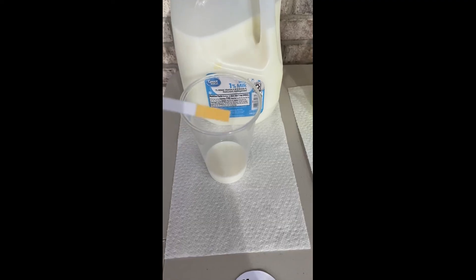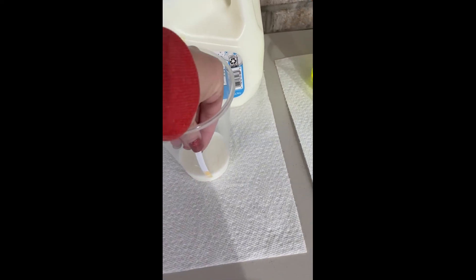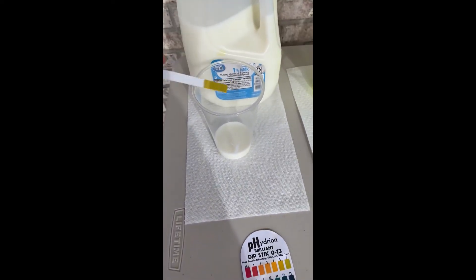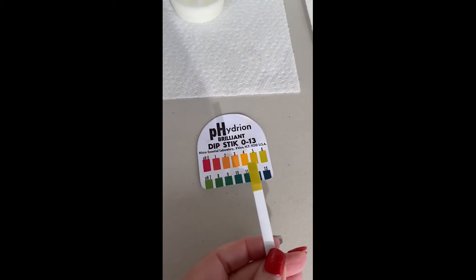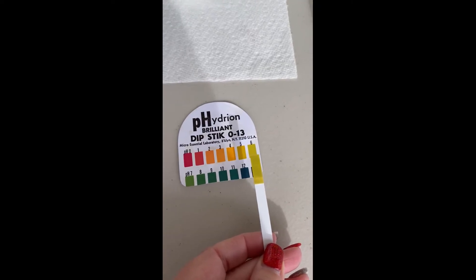Last one, we have milk. Go ahead and dip it in, and you can see that it does turn colors pretty much right away into this light greenish, kind of yellow color, and it is a 6 for sure.